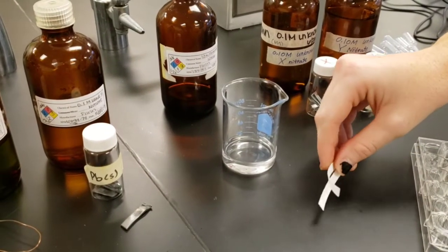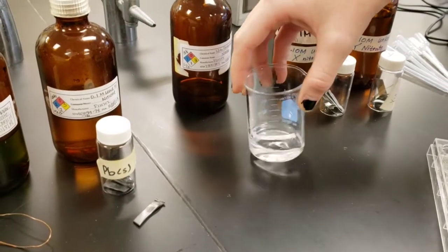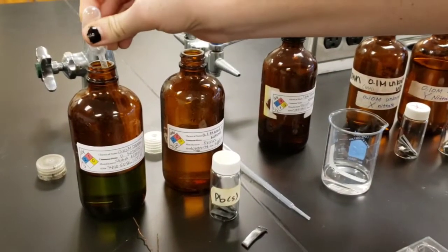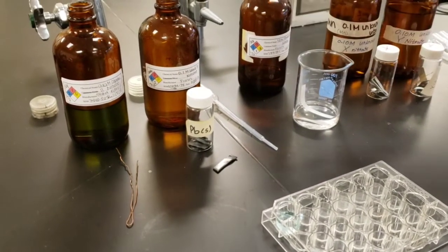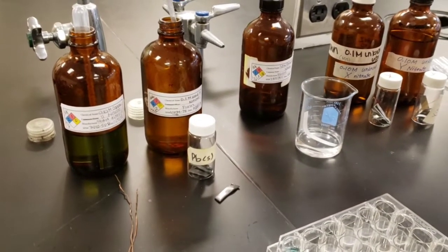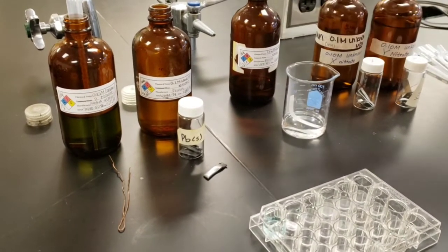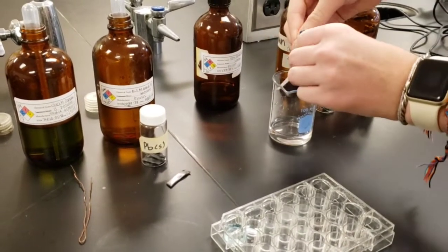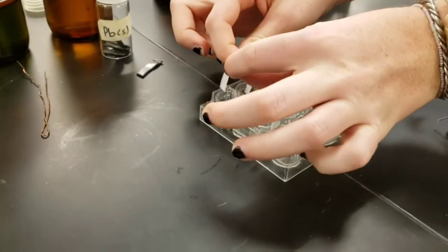First, soak the strips of filter paper or string in the potassium nitrate solution. They only need to be in there for a minute. Place about 2 milliliters of the copper nitrate solution into one of the wells in the well plate. Next to it, place a couple of milliliters of the lead nitrate. Place the salt bridge that you've made by immersing the filter paper in potassium nitrate between those two wells.